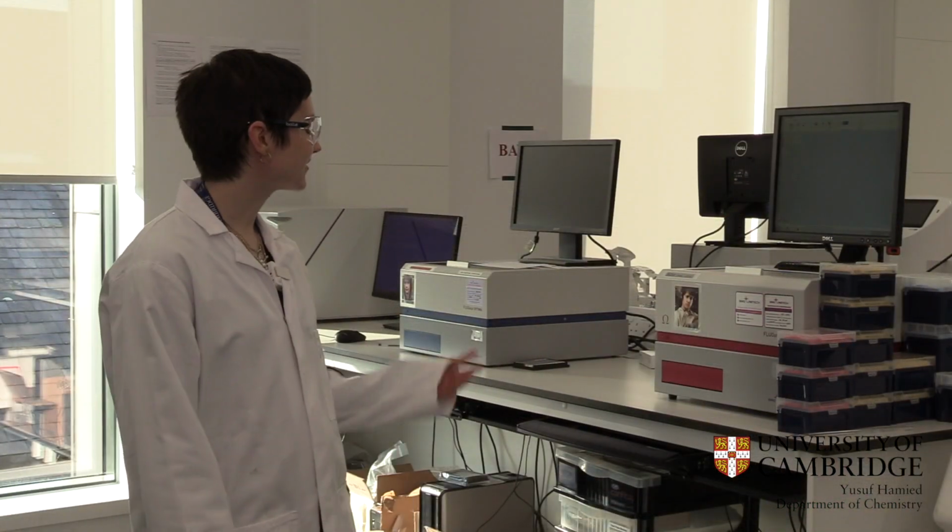Okay, so here we are in front of the plate readers. This is probably one of the most heavily used pieces of equipment in the lab, and as you can see we have 5 of them, which is really good because it means we can do a lot of simultaneous experiments. And what we usually use these for is to look at aggregation of protein, and so we can see how the protein assembles into amyloid fibrils. And this is also really helpful because we can look at things like drug screening and see how small molecules and antibodies affect the aggregation kinetics of the proteins.